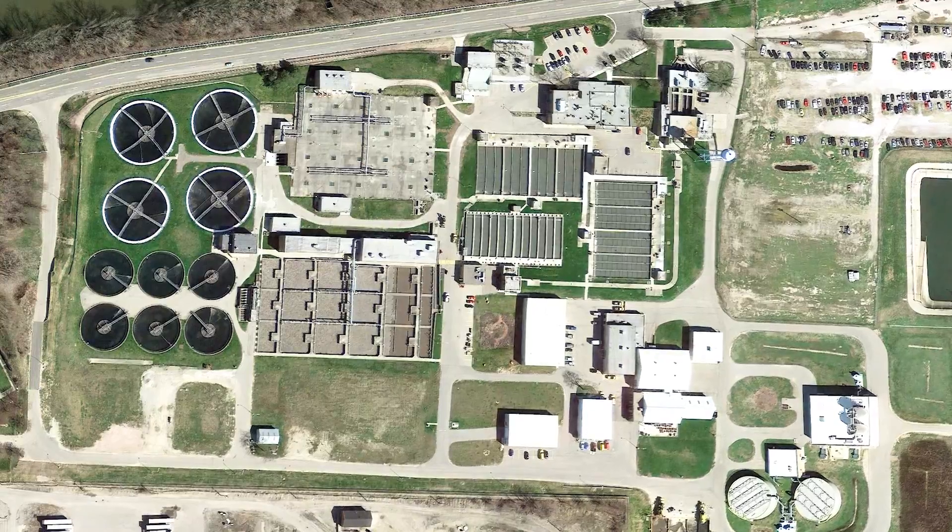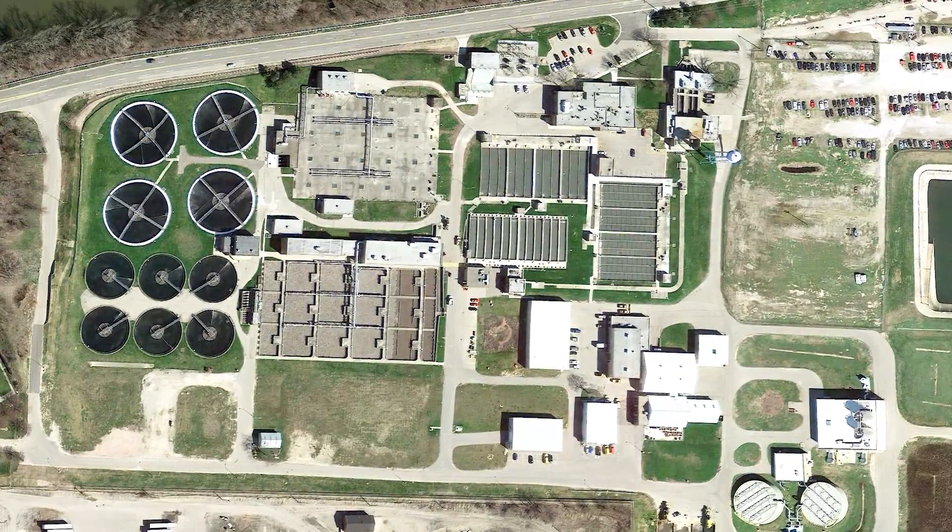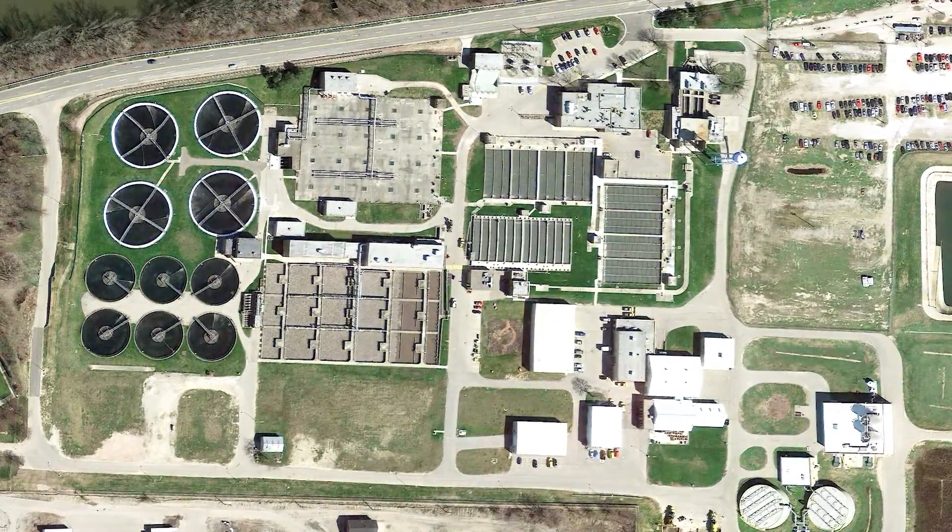The Grand Rapids plant has a 42.2 MGD flow rate and is composed of a north and south plant. The city of Grand Rapids partnered with HAAC to conduct a study on the south plant. They took one aeration tank and used it as a control, running it with their traditional set parameter of 3 milligrams per liter dissolved oxygen, then installed DO probes and ammonium probes in the second aeration tank to allow the probes to fluctuate the blower output.